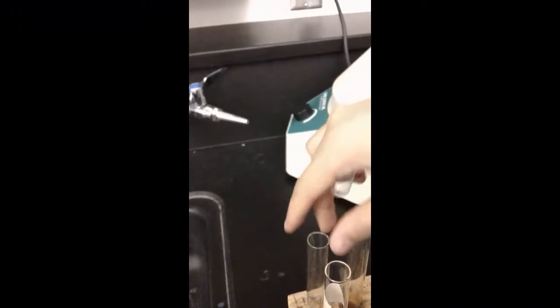So that's Fe. Now I'm looking at my Zn. So here, and I need to remove my solid from my liquid.